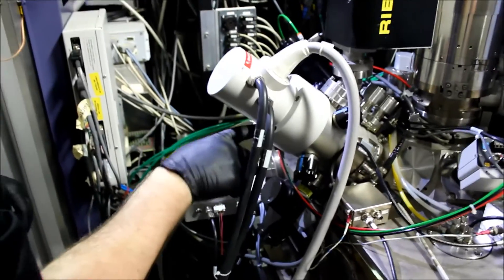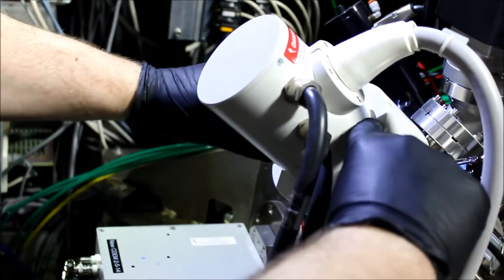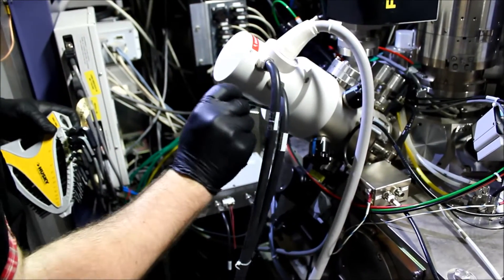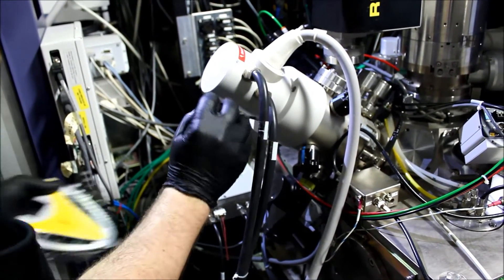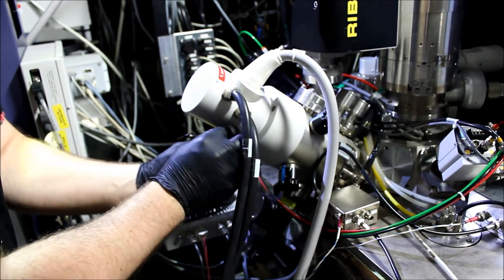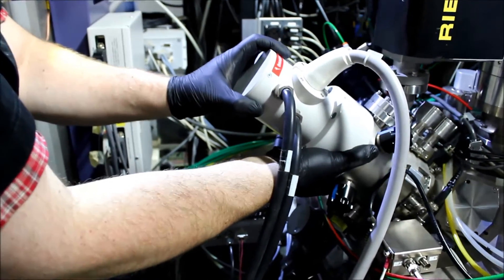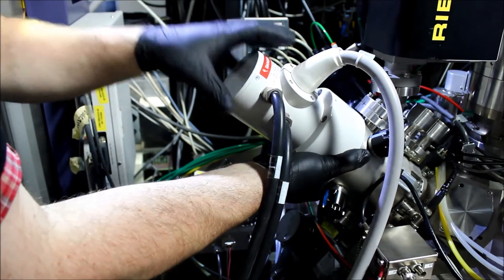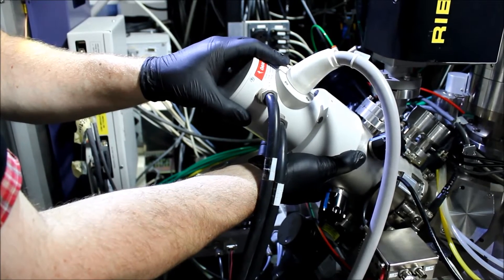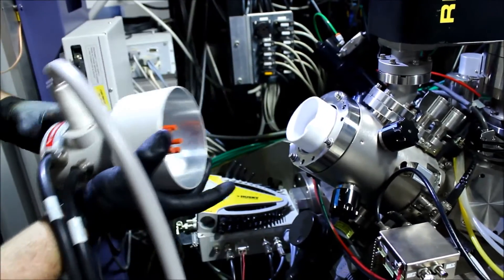We can take an Allen wrench and unscrew these four bolts right here — we only have two here because you don't really need four, but you might have four. Go ahead and unscrew these. Once you remove this high tension cap, you're going to want to lay it somewhere clean, so we've got some aluminum foil. We're going to disengage this high tension cap from the rubber plugs that are in there — it takes a little bit of force but you can feel it wiggle off. Don't be scared, pull this straight off and you can see inside.